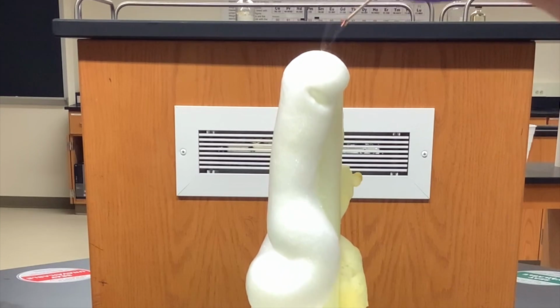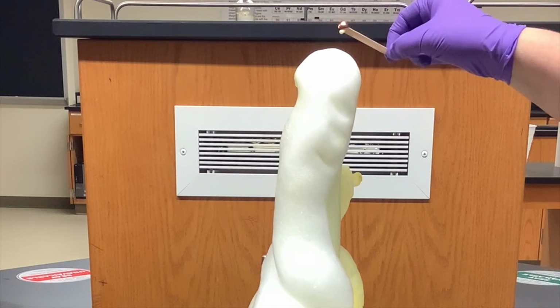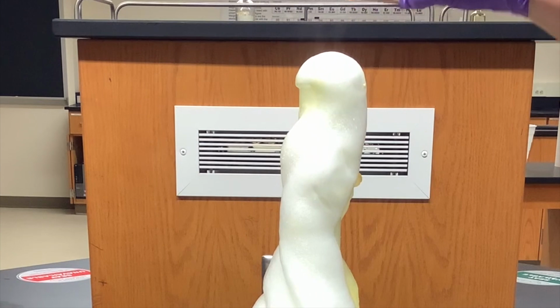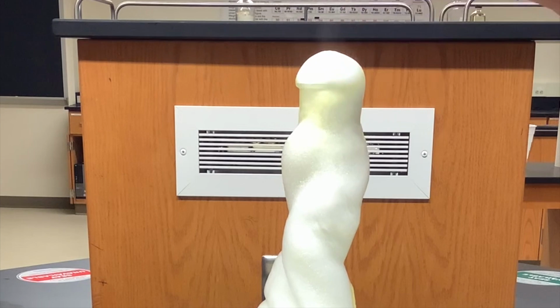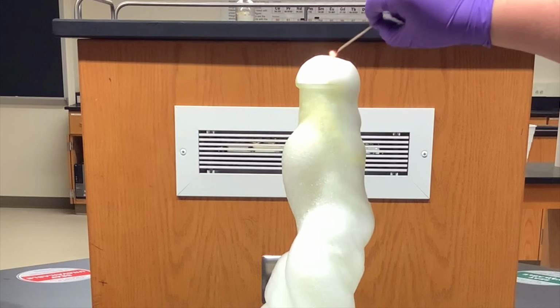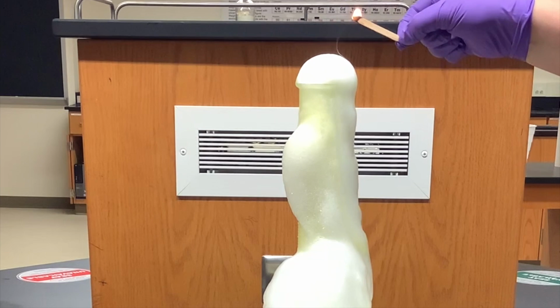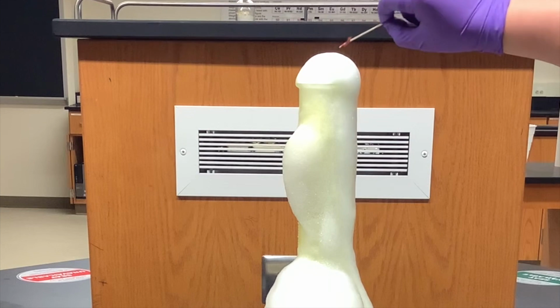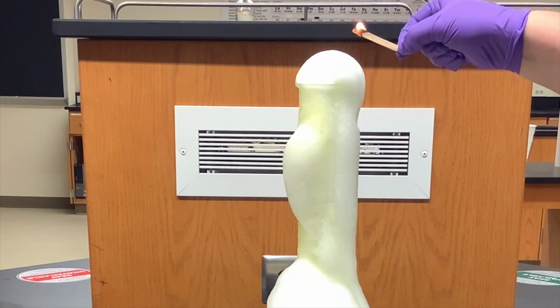The oxygen-rich layer is allowing the flame to reignite. So I get that flame back because oxygen supports combustion. It's one of the reactants needed for combustion. So in a hospital setting, oxygen is always kept isolated because it supports combustion. So you don't want an open flame to break out in the presence of oxygen and another combustion source. So you keep the oxygen isolated and try to minimize its effect on any fires that happen to start.